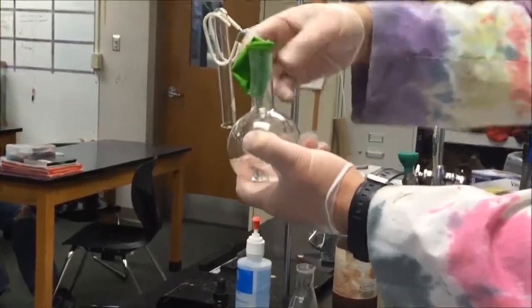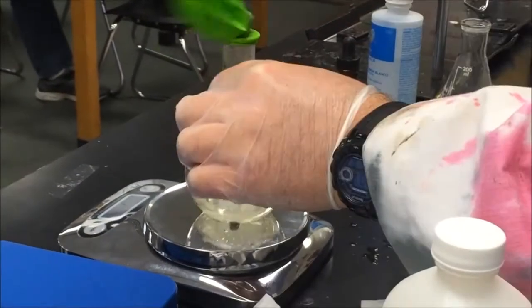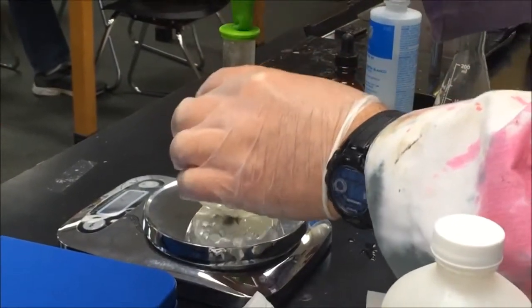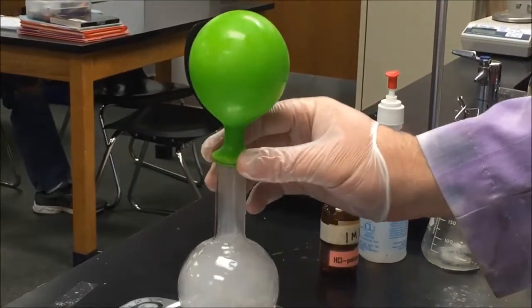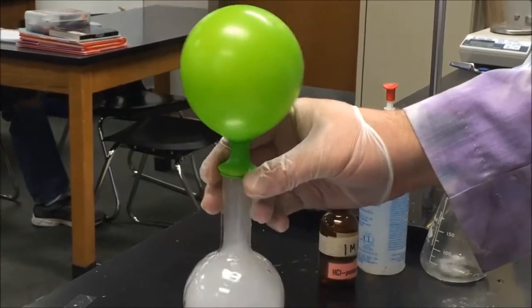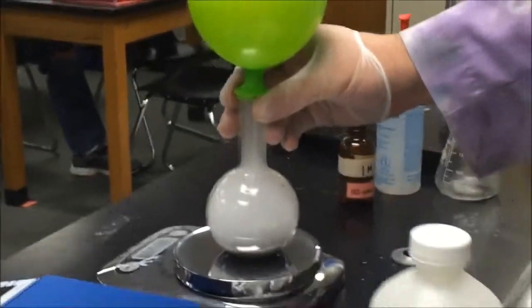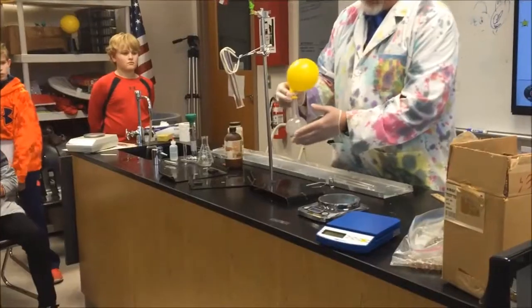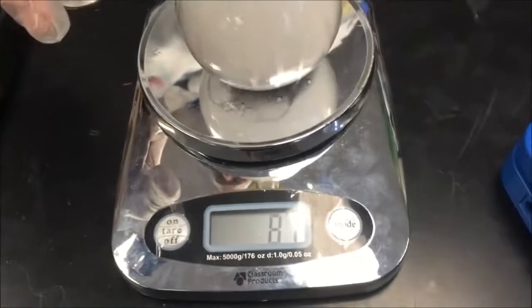Well, this shouldn't explode at this point. There we go. I see the air. I can see it. It's bubbling — can you get it back please? It's bubbling like crazy. By the way, this is getting quite hot. Okay, get the mask real quick. What is it? Still 81 grams.